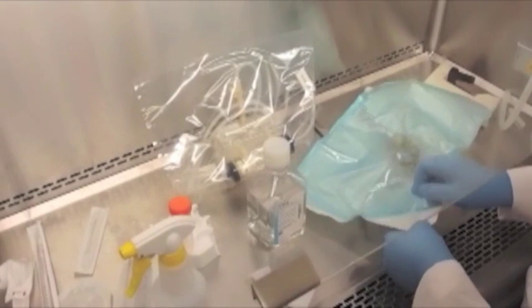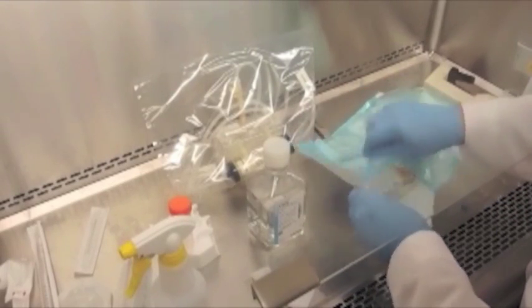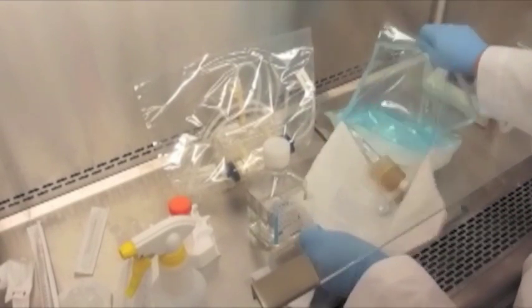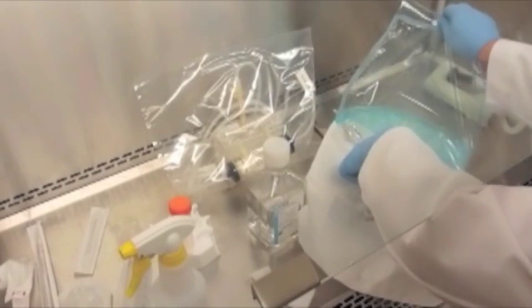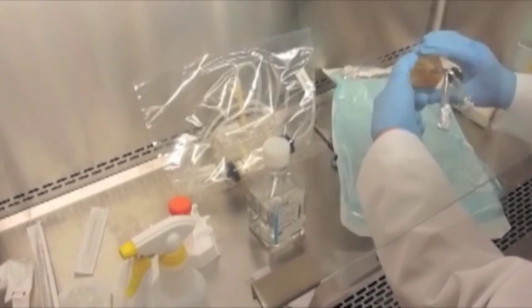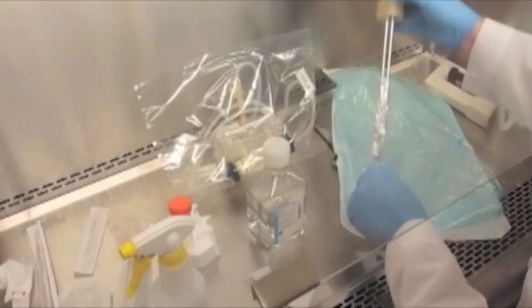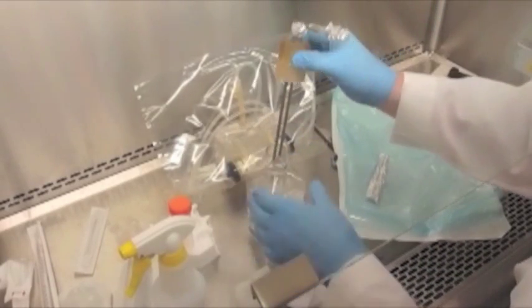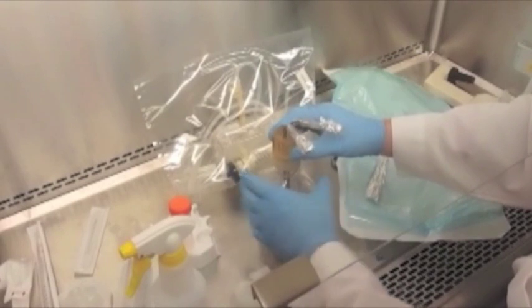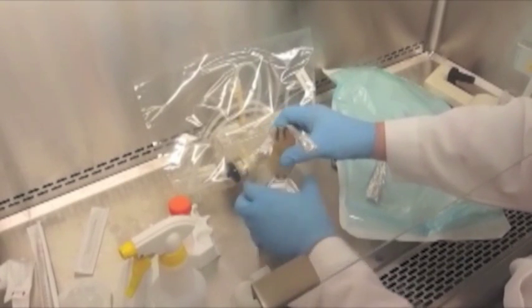We have the reservoir cap prepared. We want to cover up the ends with aluminum foil and also the short pieces of silicone tubing so that we can safely remove it from the autoclave bag without touching anything. Screw the cap onto the bottle of PBS.